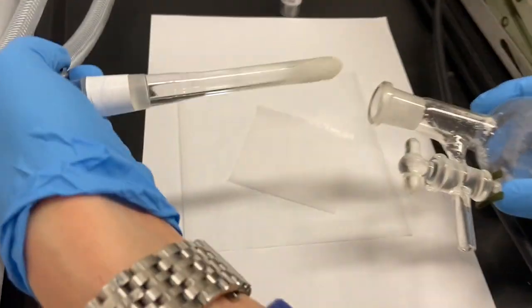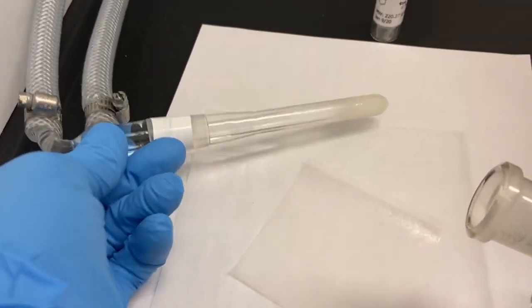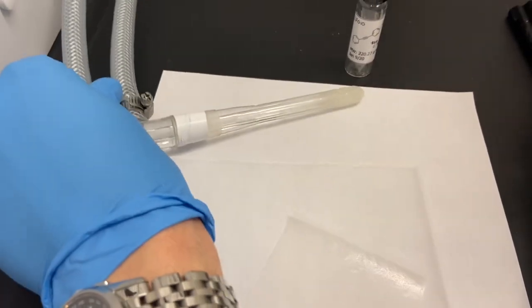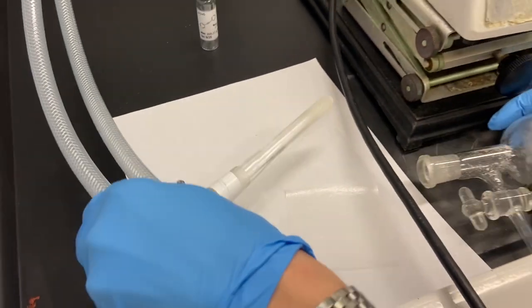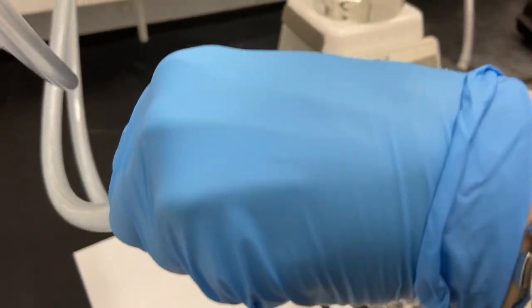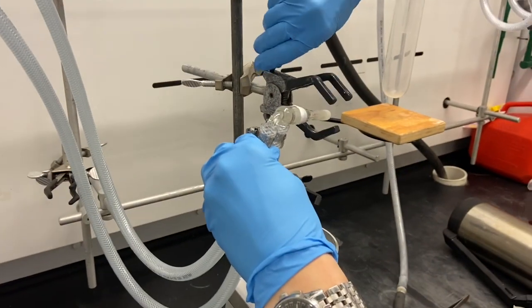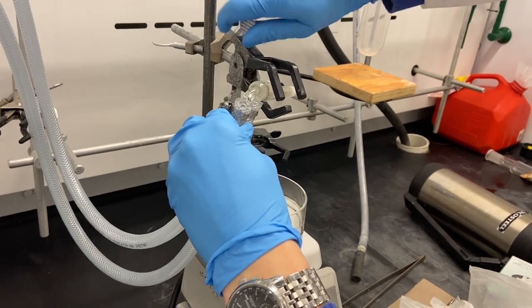Yeah, and you can see sadly most has fallen off. We'll take care about that in a minute. Let's see if I can lay it down there. Luckily we always have some extra hands.